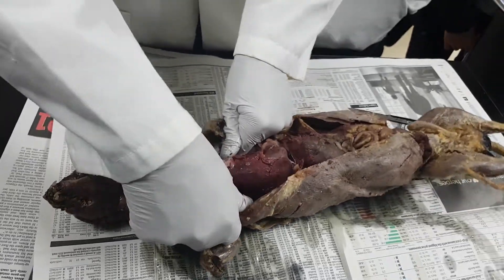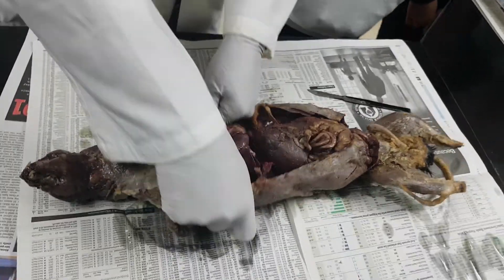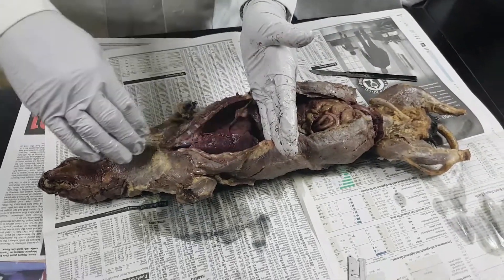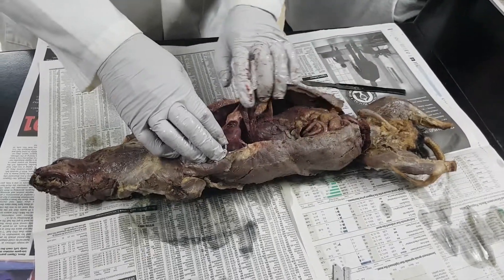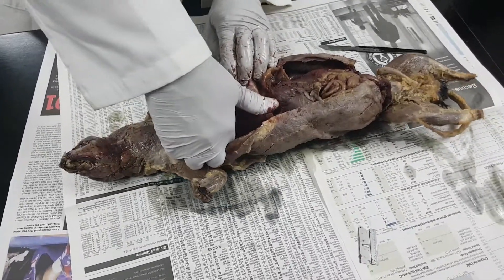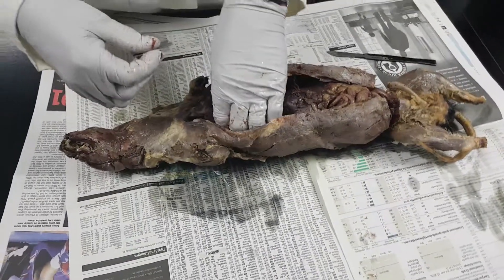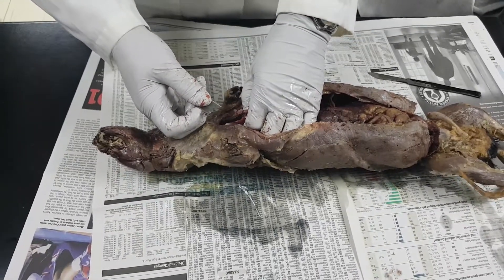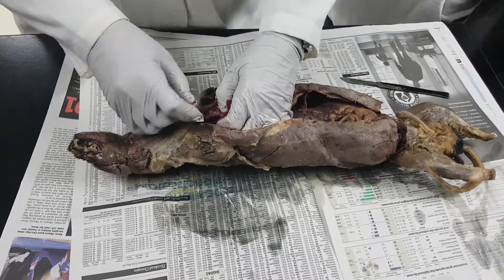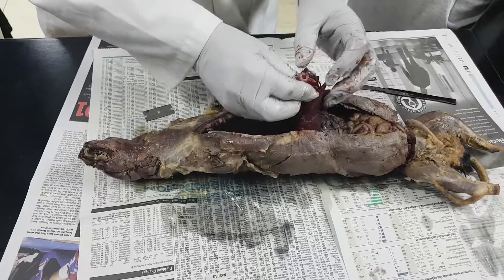So I'm going to pull this over here. Now I'm going to take out — this is the abdomen. Everything above is the thorax and everything down below is the abdomen. I'm going to take the heart and lungs out first. I'm going to cut the trachea, which is where the air goes through. I'm going to cut the superior vena cava — that's where the blood from the head comes to the heart. And I'm going to cut the esophagus — that's where the food goes down to your stomach. So I got that cut off. There are the tubes right there — you can see some openings.